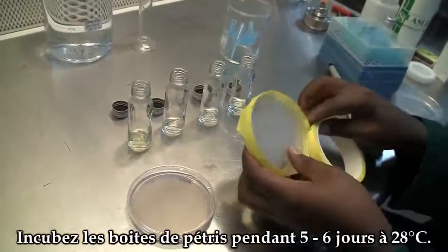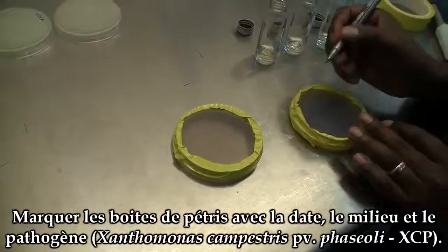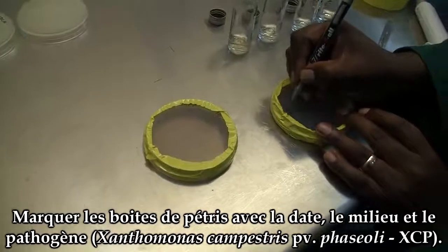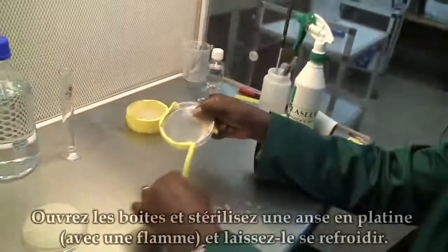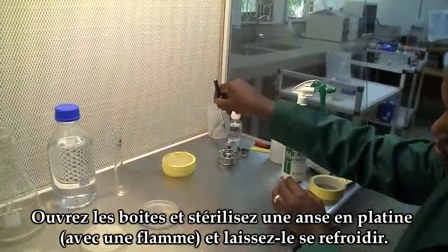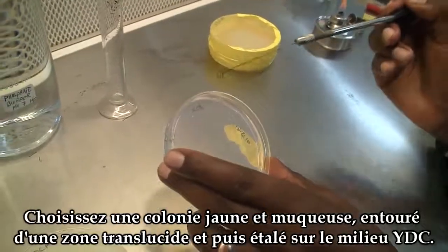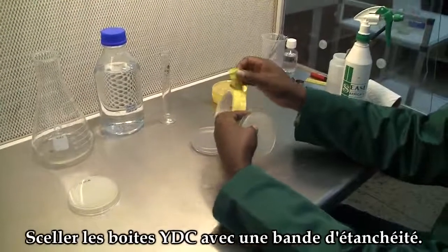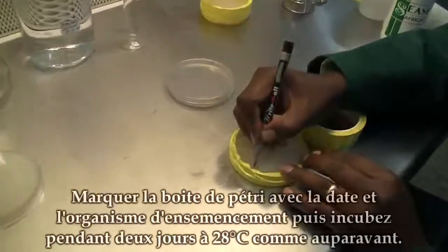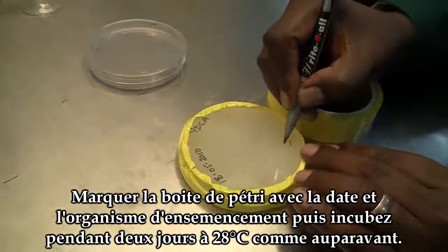Incubate the plates for 5 to 6 days at 28 degrees Celsius. The plates should be well labelled showing the date of plating, the pathogen, and the media. After 5 to 6 days of incubation, remove the cultures, open up the plate and sterilize the wire loop. Allow to cool, then gently touch one colony and streak the surface of YDCA media. Seal the inoculated plate securely using sealing tape, label it with the date and organism, and incubate for 2 days at 28 degrees Celsius.